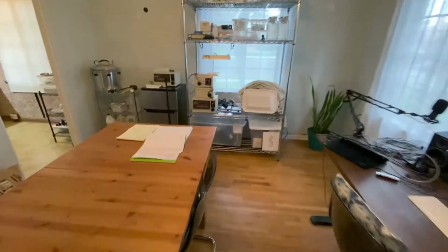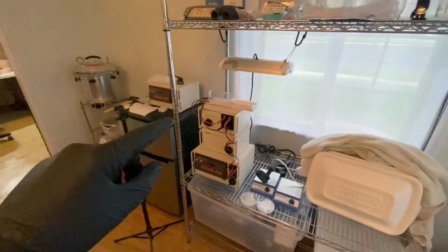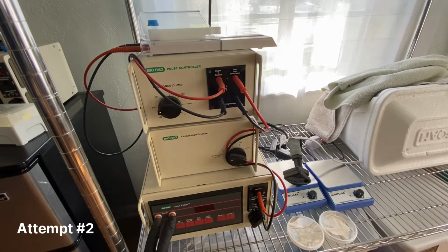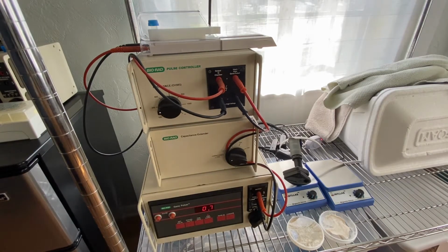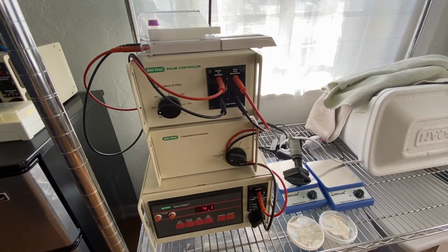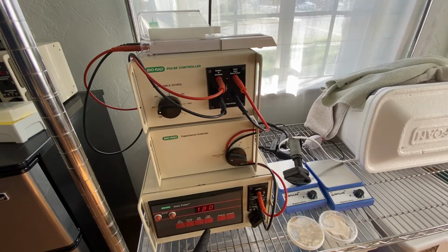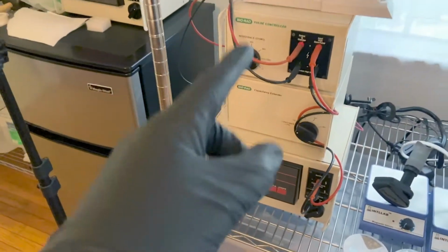We are trying to master electroporation, and what you'll see is this past week I have made many attempts. 4.5. 4.5 on the time constant. 0.7, that one did not work. Yes, good run. 4.1. Wow, it actually worked. 4.5. Excellent. 4.5. And I have had quite a few successes in terms of running it.